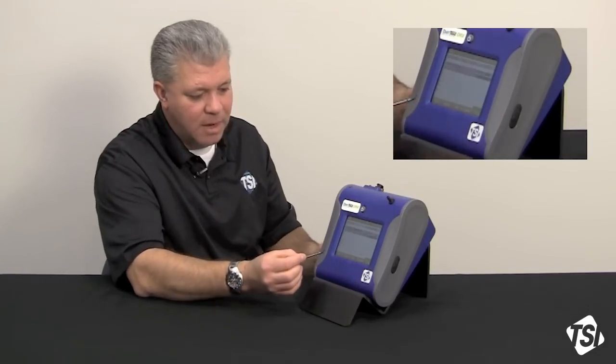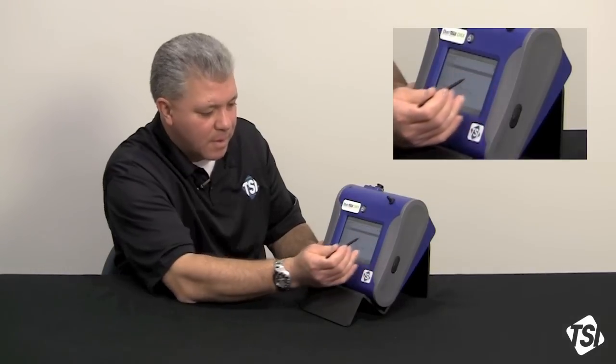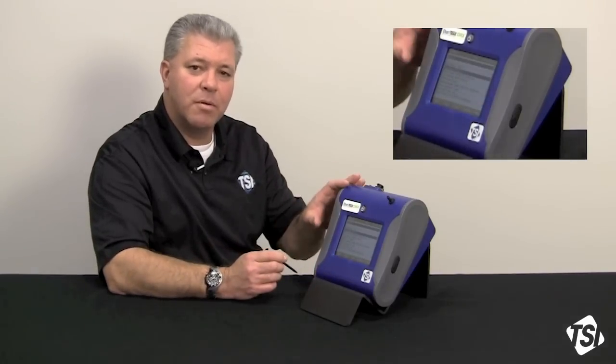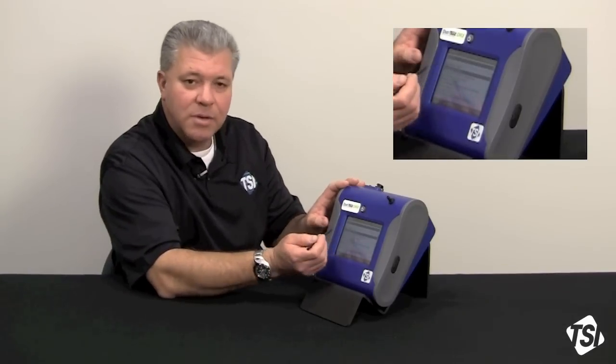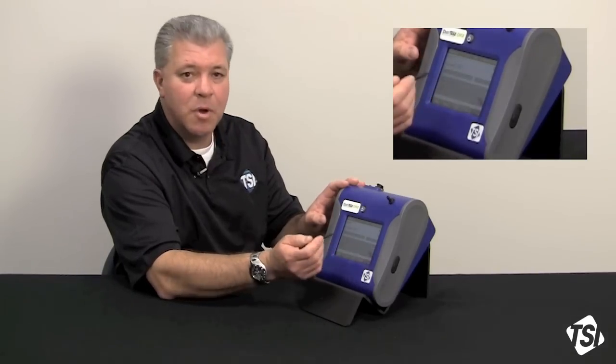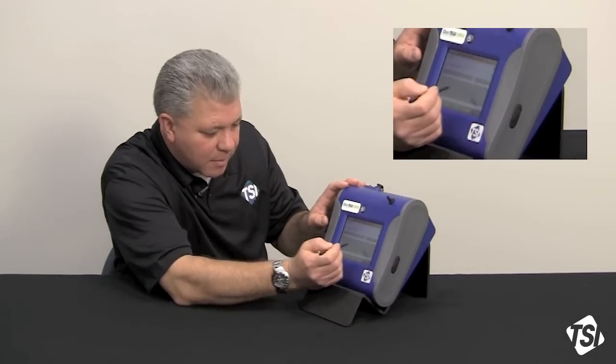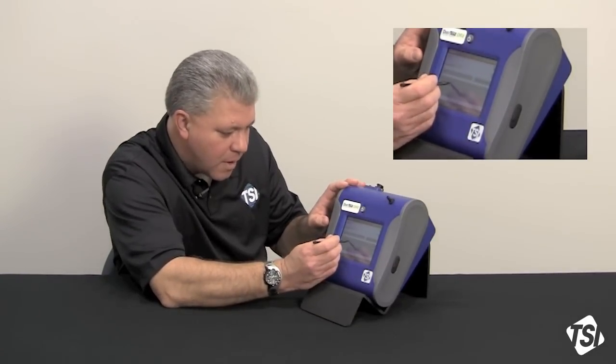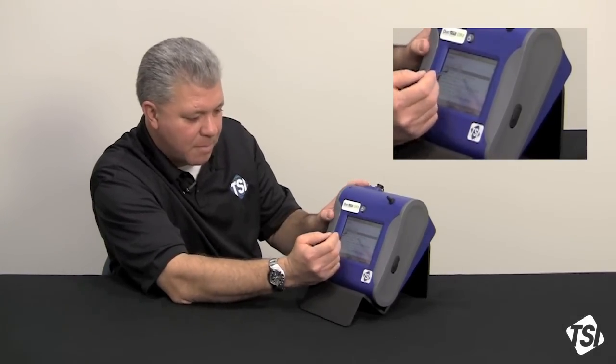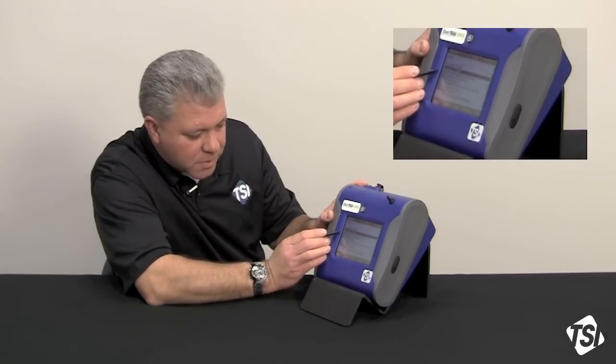Now, let's go back, and let's look at a more comprehensive logging program. Go to the upper drop-down menu, and I'm going to go to one of the other tests. Now, the nice thing about the program log mode is that you can actually name your test file, so I can get in here, and I can put in a custom nomenclature name, and I'm just going to use the backspace key, get rid of test 1, and I'm just going to go www, and hit save. Now, that's my test program.